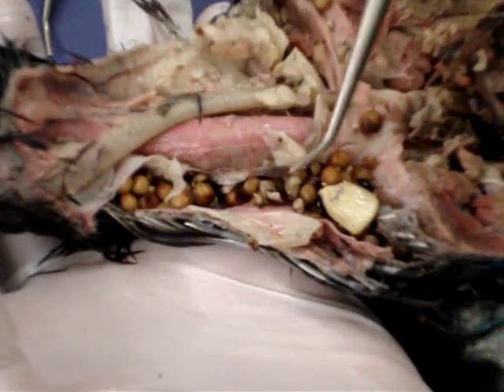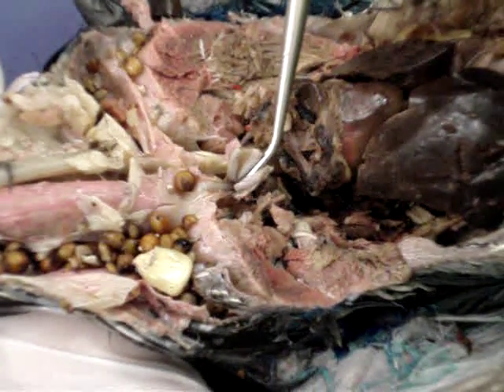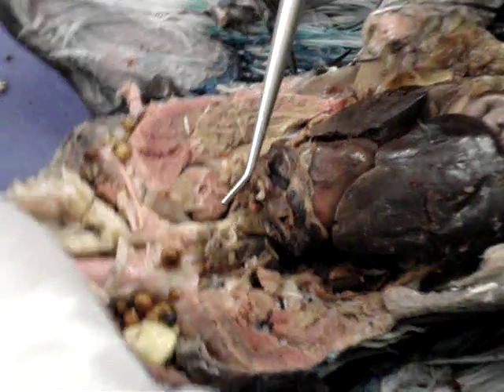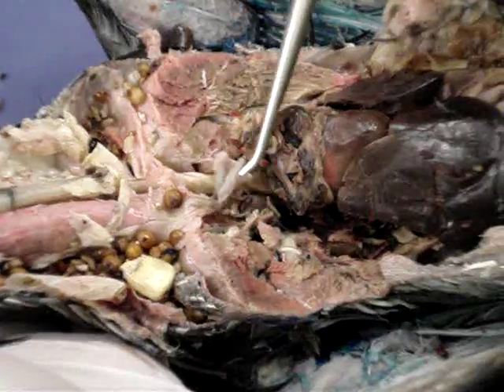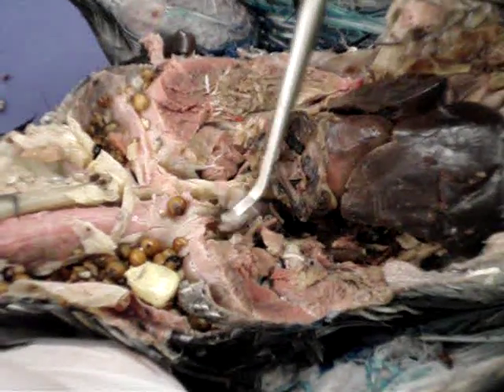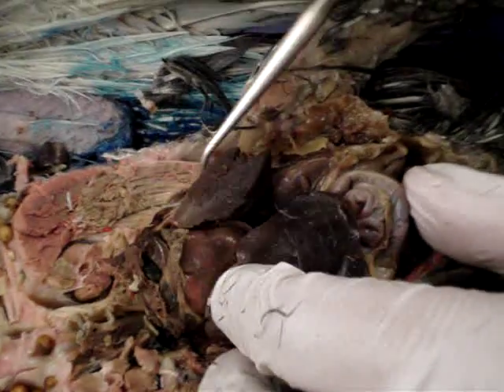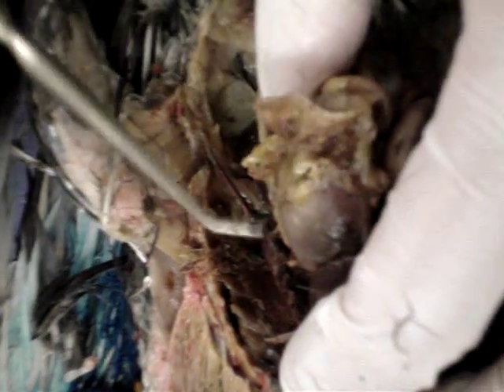The crop then leads down to the pro-ventriculus, which leads to the stomach. It's this structure right here that can be found above the heart. The gizzard is down this way, underneath the right side of the liver. The gizzard is this hard structure here.